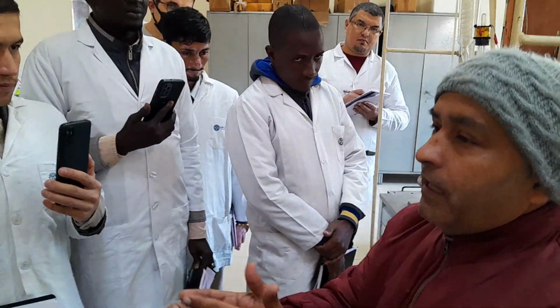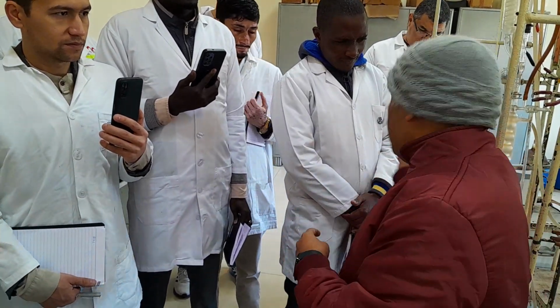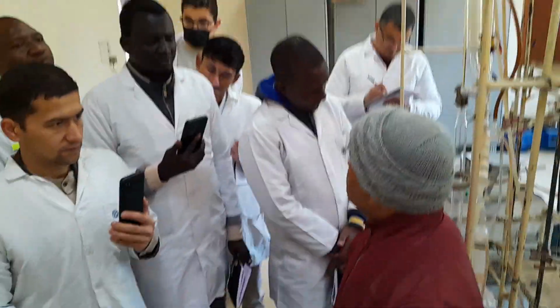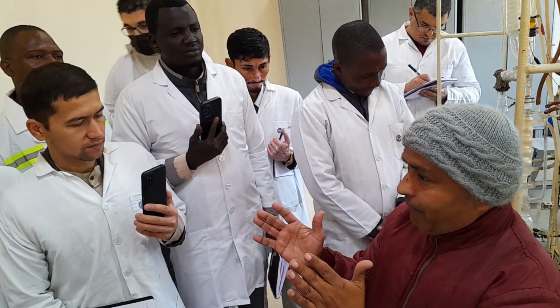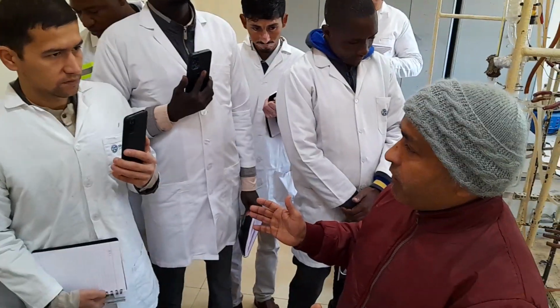For example, if my naphtha boiling range is 20 to 140 degrees centigrade, my IBP is 20 but in D86 it is 30 or 35, but the FBP is 140 because you are distilling the crude oil until you get the final drop at 140 degrees centigrade. But here you are testing that particular naphtha where you have a range of only C5 to 140 degrees centigrade, or 20 to 140 degrees centigrade.